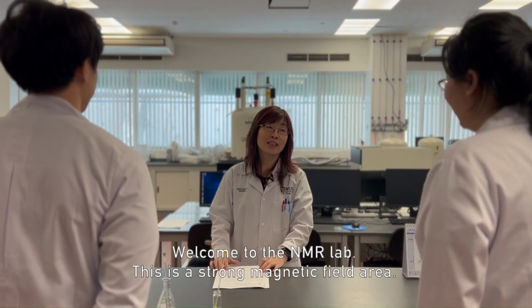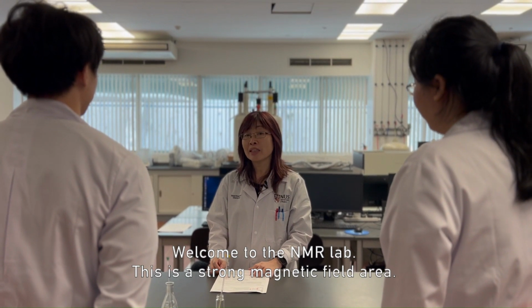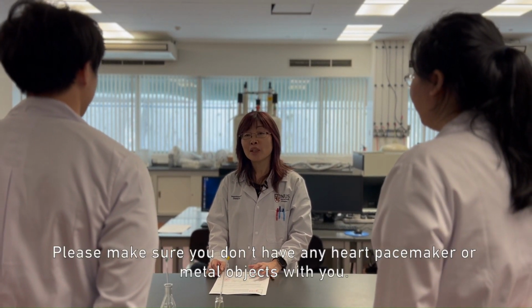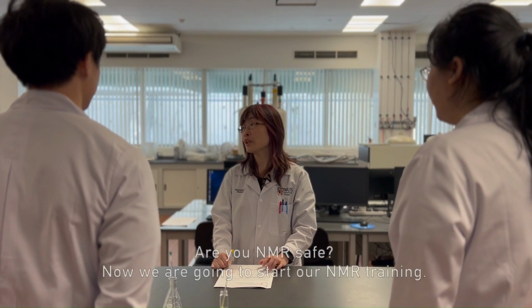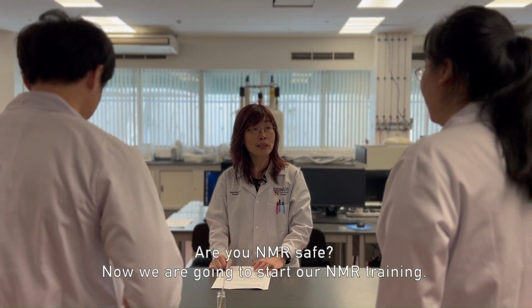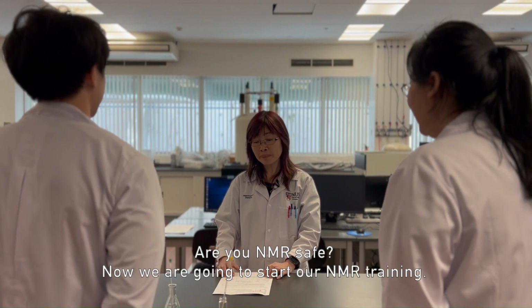Welcome to the NMR lab. This is a strong magnetic field area. Please make sure you don't have any heart pacemaker or metal object with you. Are you NMR safe? Now we are going to start our NMR training.